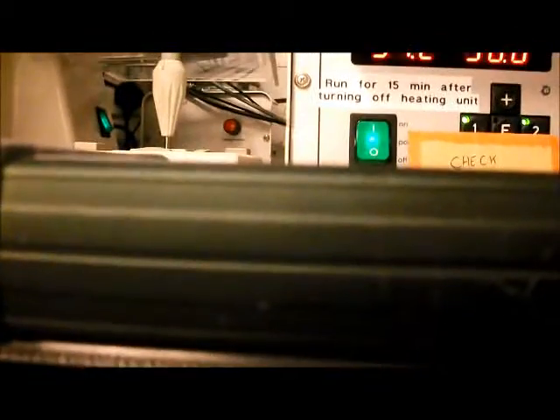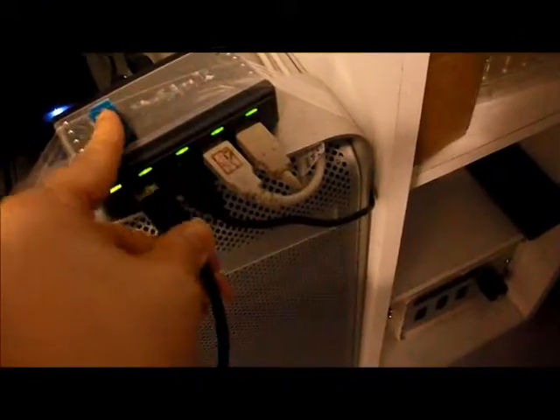Just put that on the bench. If you're not using fluorescence, then the fluorescence box here is not turned on, so there's a spare plug here. So just plug that in at the back and put the USB in the spare USB port here, and then stop the Volocity file. Turn that off.